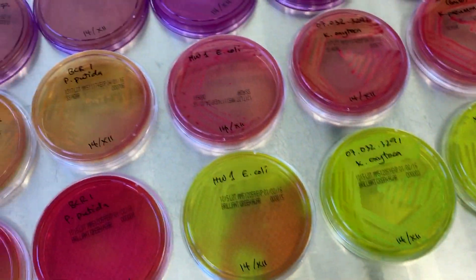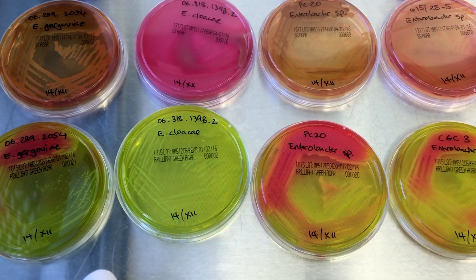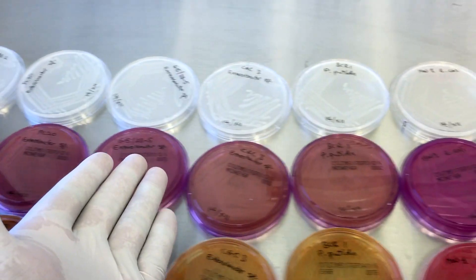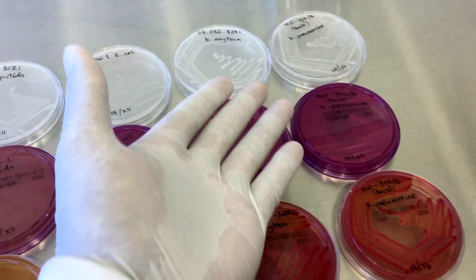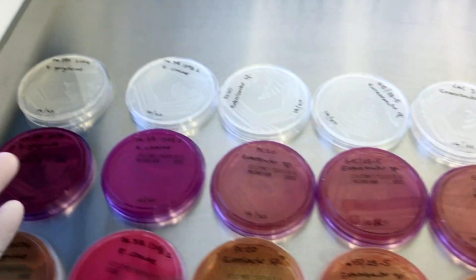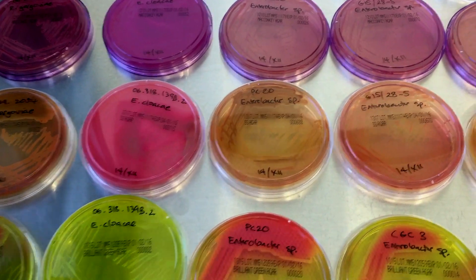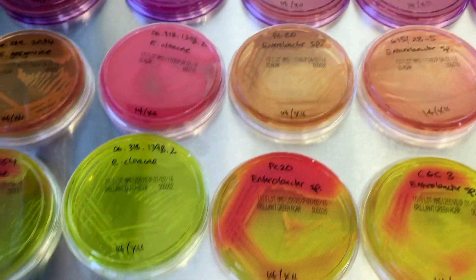This brilliant green Agar is probably the best type of Agar in isolating Enterobacteriaceae species from the guts of the Queensland fruit fly. The Enterobacter media was the best media in which Enterobacteriaceae cultures grew on — all of them grew very well on this compared to the other Agars, but it doesn't give me any coloration.